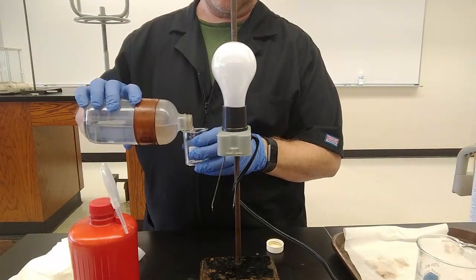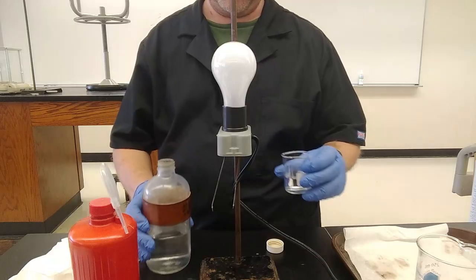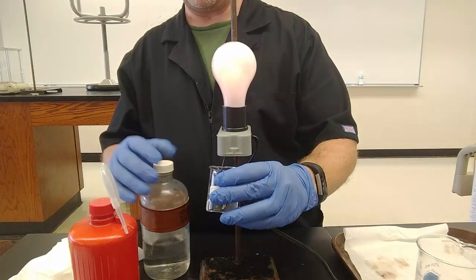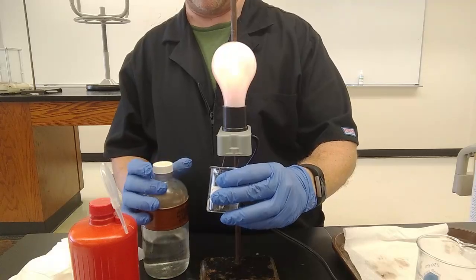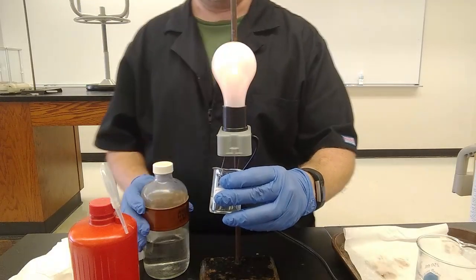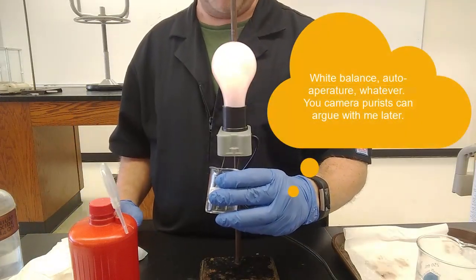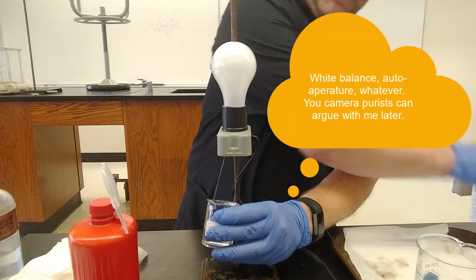Weak base. Let's add some to this beaker. A little one. Ammonia is smelling salts, so it's blasting me in the face right now. Again, hard to tell because of the white balance, but this light is very, very dim, just for comparison.